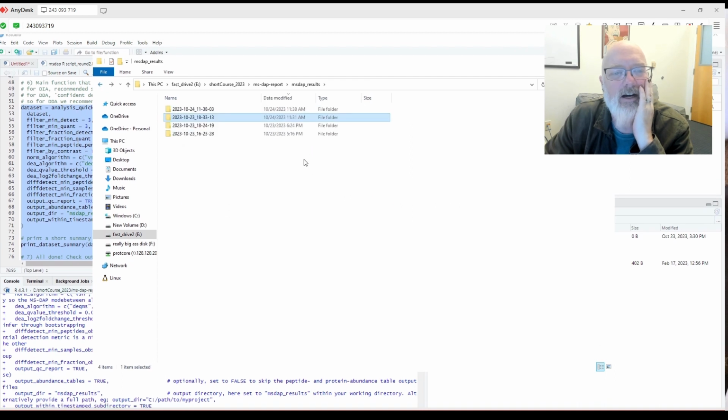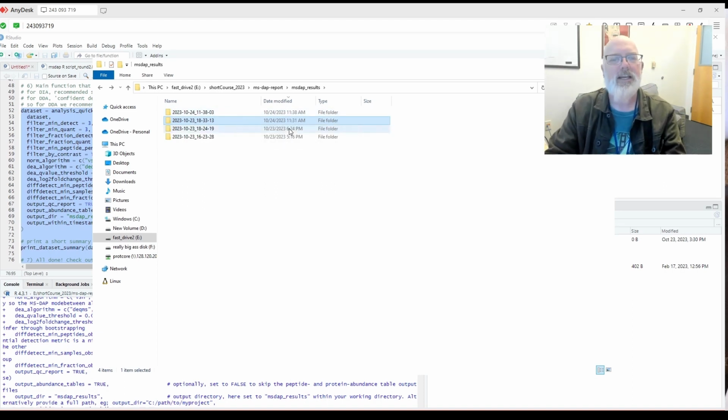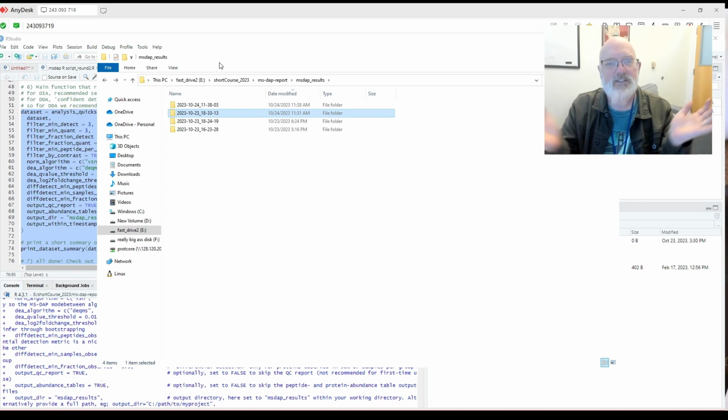So you don't have to worry about it overwriting any of your old stuff, which is awesome. So I am loving MS-DAP so far. So I think it's a great way to do some sophisticated differential expression of either the Spectronaut files we give you or DIA-NN or FragPipe or anything. It looks really cool. So those of you who get data from us, feel free to try it and let me know how it works. I'd love to hear it.